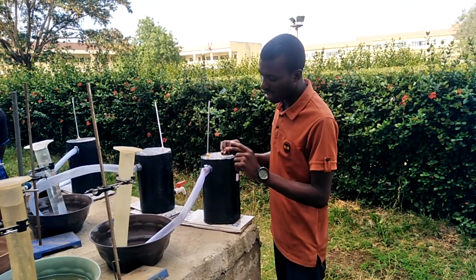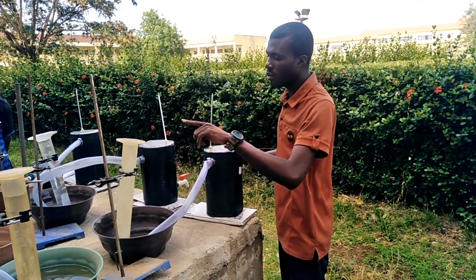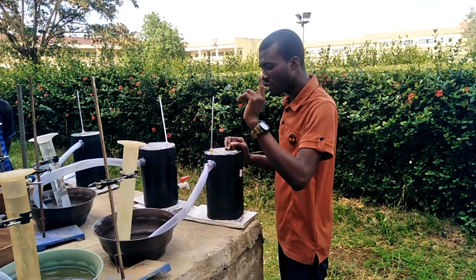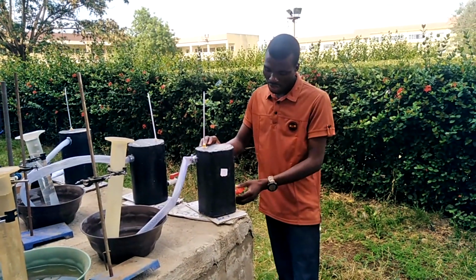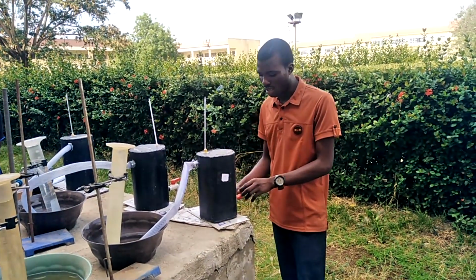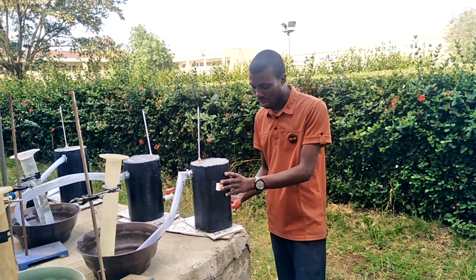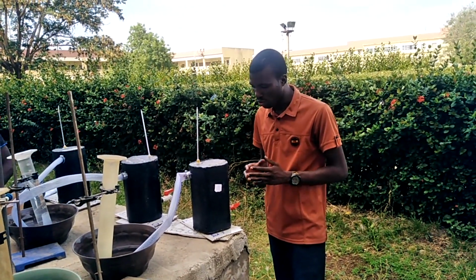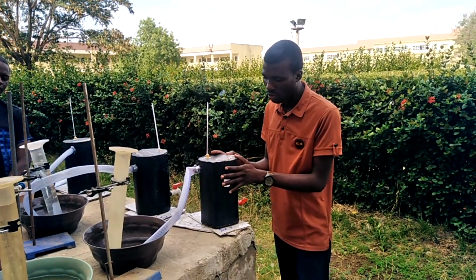And then we have another opening here where the pipe goes into the cylinder, making an upward delivery and downward displacement. Then we have another opening here, which is a tap head. Here we take a little quantity of the liquid inside the bioreactor and then run our pH to know the pH inside the reactor.